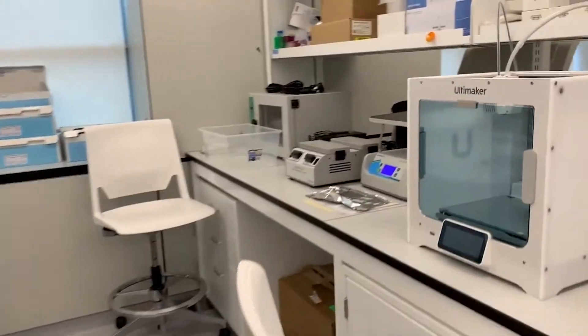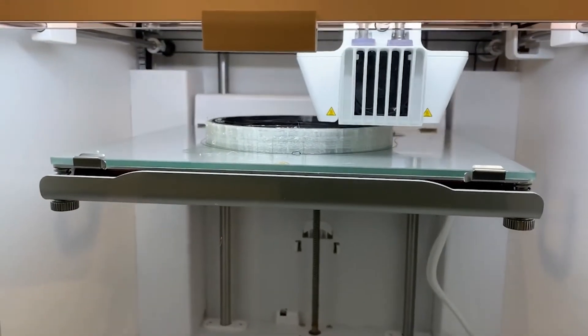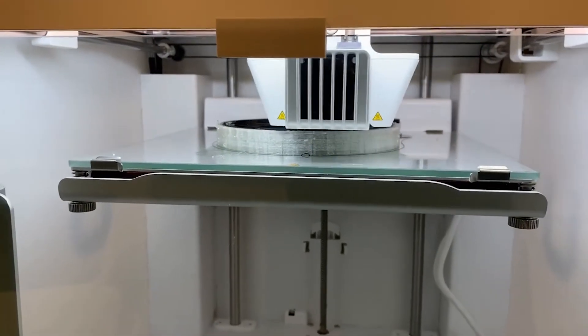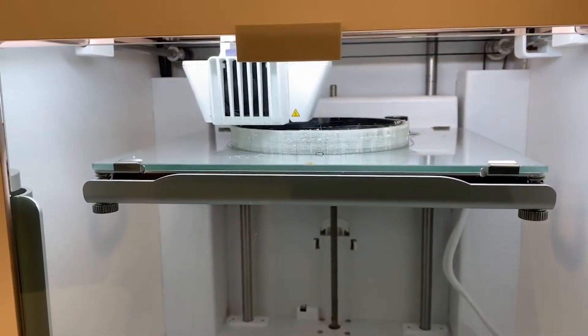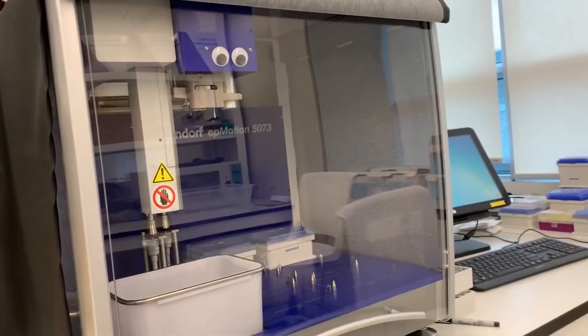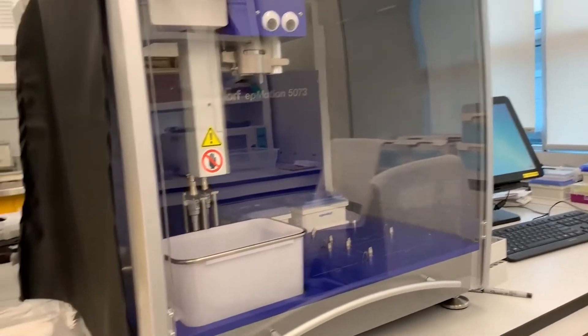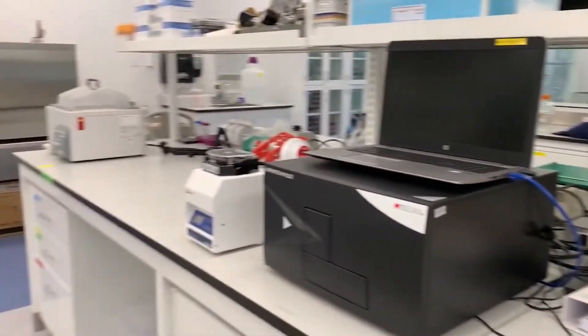Look! Our 3D printer is working on a piece for a new design. Other pieces of equipment here are a liquid handler, a plate reader, and an in-house autoclave.